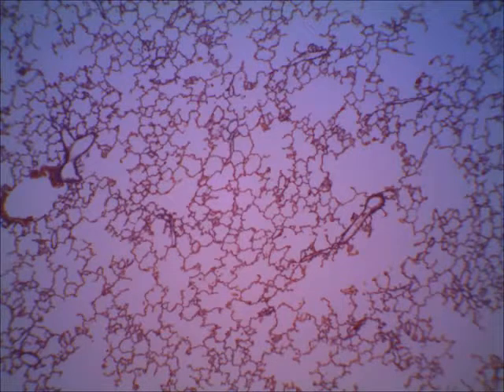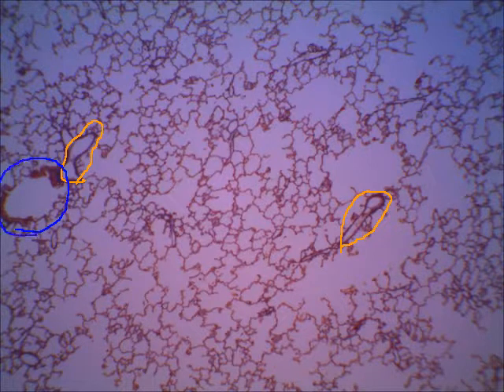So on these next slides, they're also on scanning. Here we can see just a little bit of a lengthwise section of a blood vessel. Now these are very small blood vessels. That's why they're not thick-walled. These are small arterioles. There's another little arteriole. But what I'm circling in blue is a section of a bronchiole. So it has that thick, wavy lining. This, again, is on scanning.